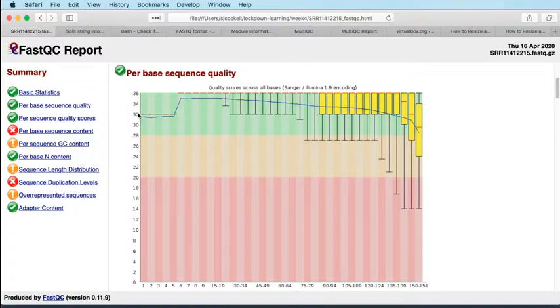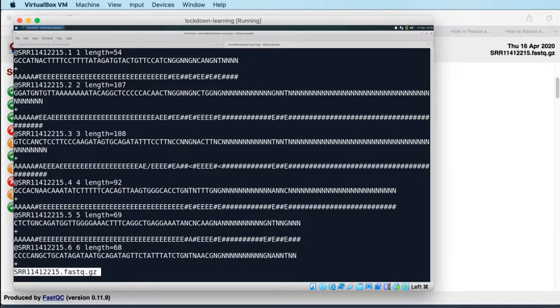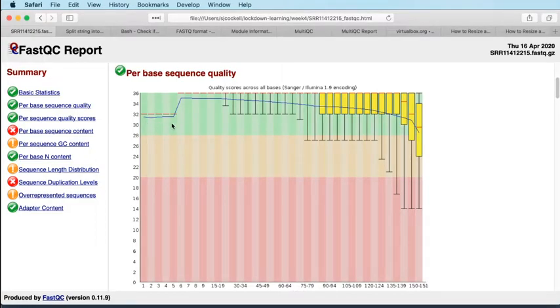So you see that basically the mean for the first 5 bases is 32, which is an A, and there's no box around that 32 because almost every base at that first position will have a quality score of an A. We can just have a look at our reads, and you can see on this first screen the first base here, or in fact the first 5 bases, they all have a quality of A. So that is bearing out what we're seeing in that box plot, those A's that we see in the FastQ, because A is 32. So we're seeing very little variance around that 32.